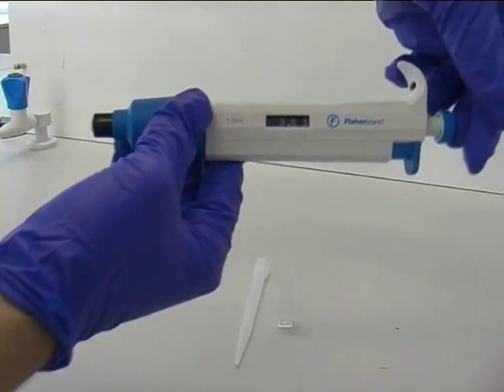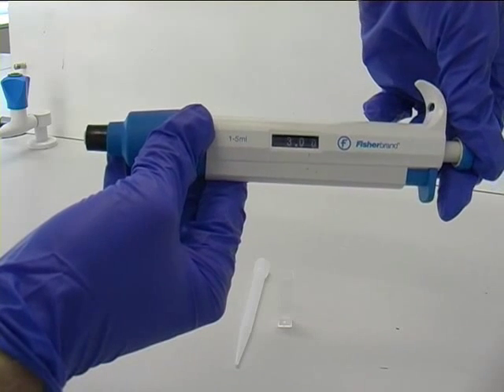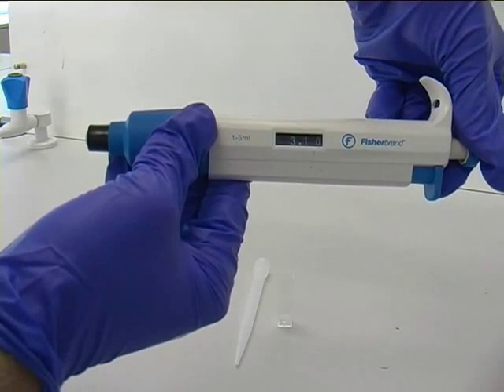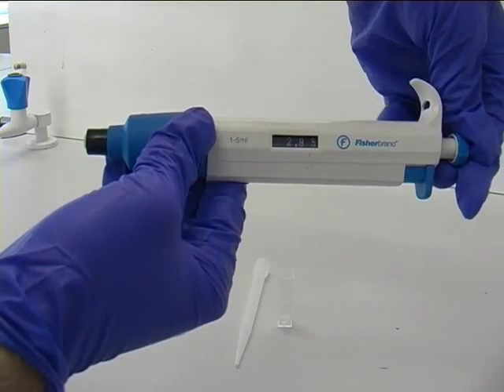The volume dispensed from an auto pipette is set by rotating the dial at the top of the pipette. The set point is shown in the window on the side of the pipette.